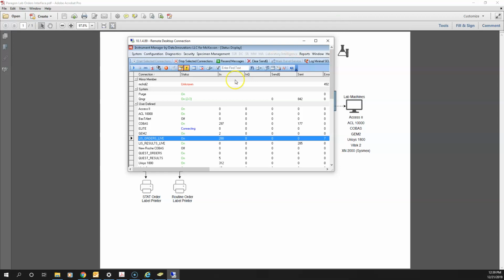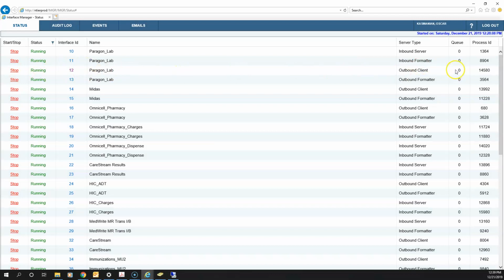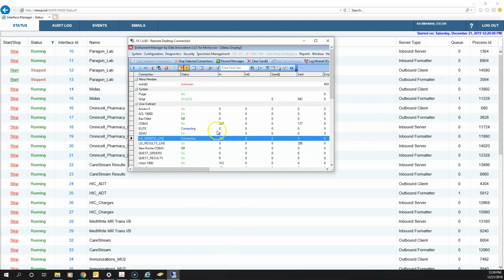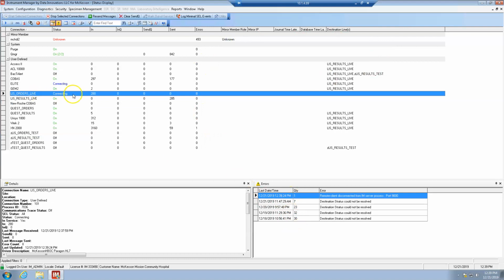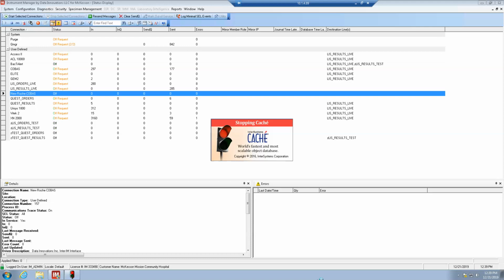Now a couple of minutes ago I had said that if you notice you've restarted this interface and only a couple of items are processing in the queue at a time, and the interface keeps stopping, the best thing to do is to stop both of these services, right? Go over here to the DI and notice how when I stopped it says connecting. Remote client disconnected from IM on port 9000. So I've closed the connection. Go here, right click on cache, stop cache, and restart. So it's going to refresh all of the connections.